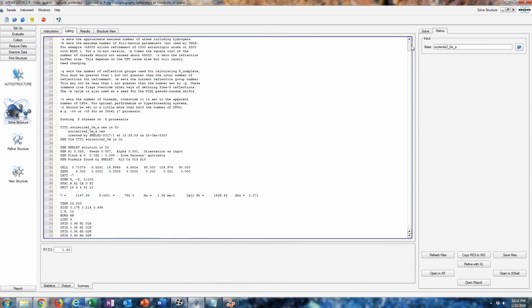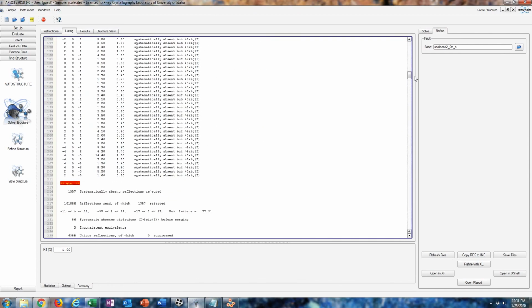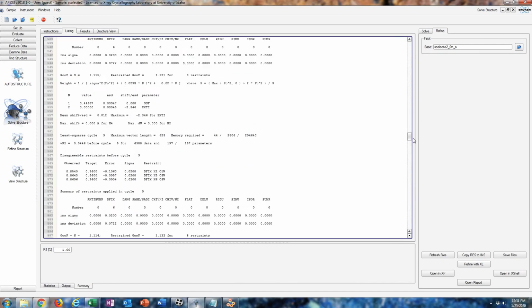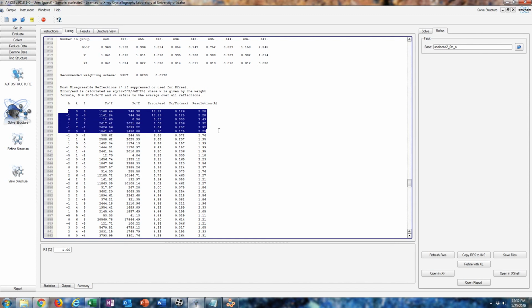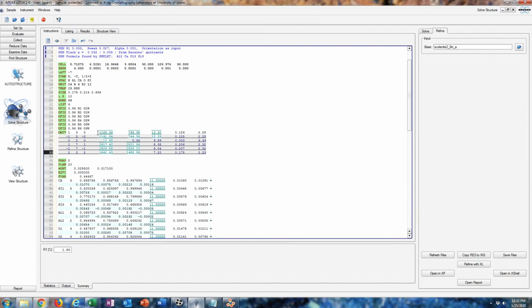And here's our list. The very last thing that you can do, make sure that you don't have any major problems here. Interesting. Okay, the most disagreeable reflections. So these disagree with our model due to maybe disorder or periodic disorder. But we can just get rid of those, if they are just from a little inclusion in the crystal or some defect in it. You can get rid of those reflections by using the omit command and entering in the HKL of those reflections. Just kind of paste them.